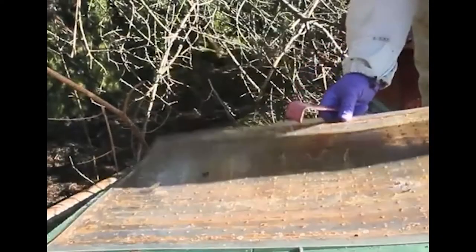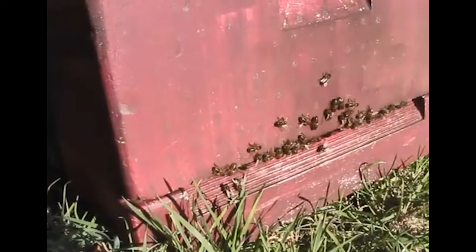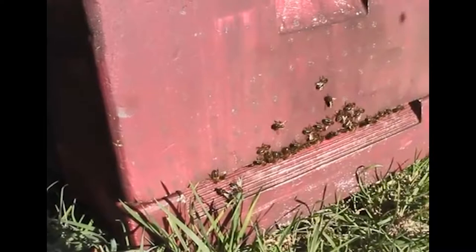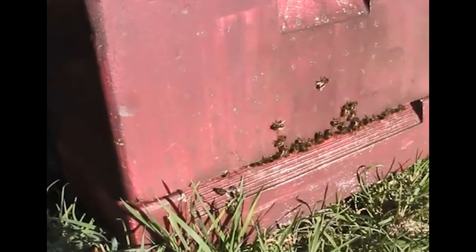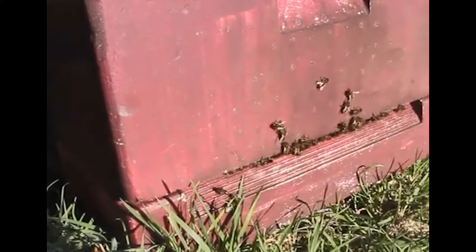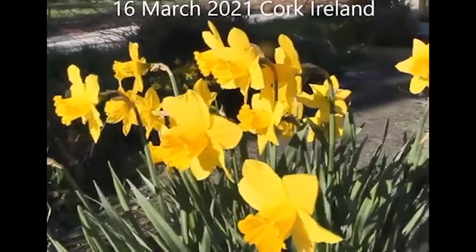It fits nicely, the crown board goes back on. It's still early morning here but the sun is shining, and as you can see from the hive entrance there wasn't a lot of disturbance to the bees at this hour of the morning. The bees seem happy enough with the samplers, and they must be taken off again. That's it from Cork, Ireland.